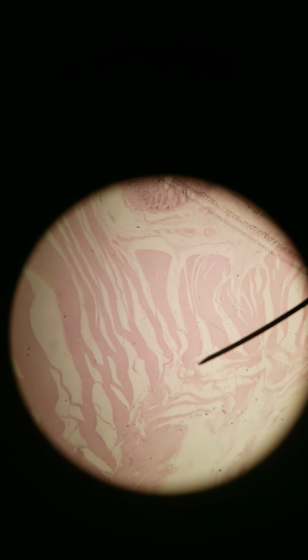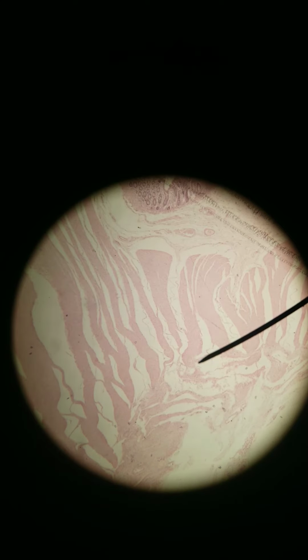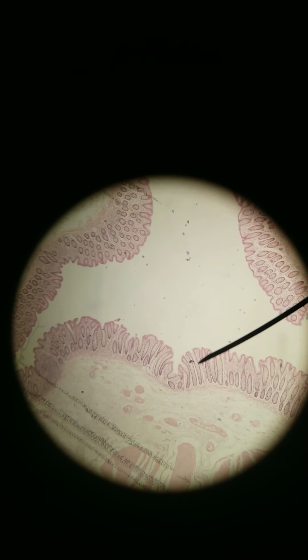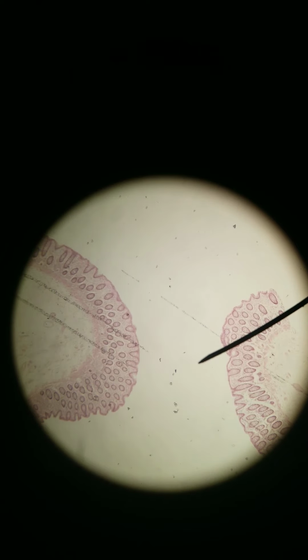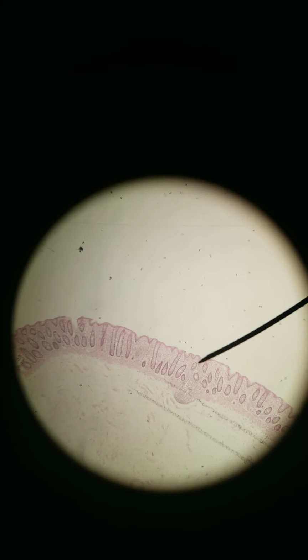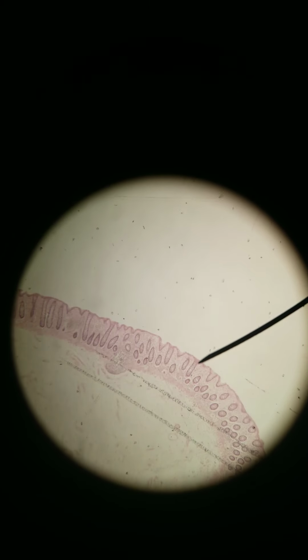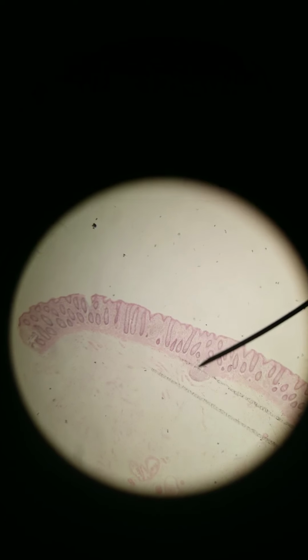If we keep going through the large intestines, we're going up the ascending colon, then the transverse colon, then the descending colon, and then the sigmoid colon. And so here, this is a section of the colon. I don't actually know which part of the colon it is, but a generic part of the colon. And again, you can see how even the apical side is compared to when we look at small intestines. The villi are much more finger-like. These just go deep in, and here's a great example of that.